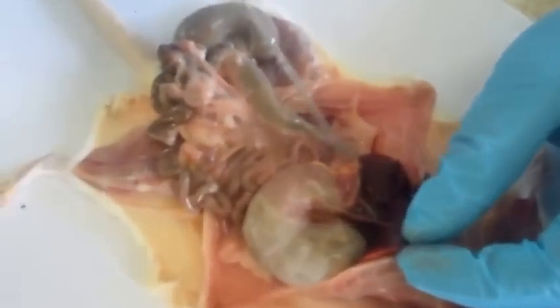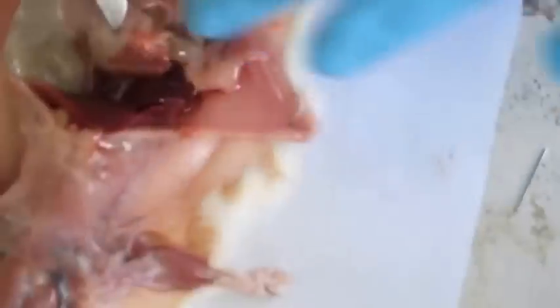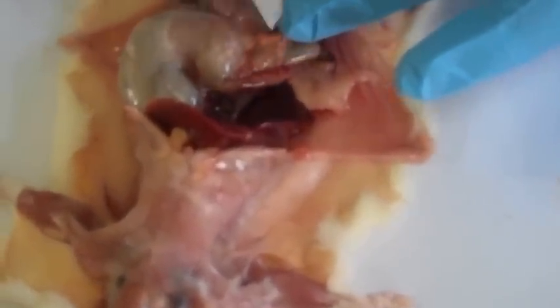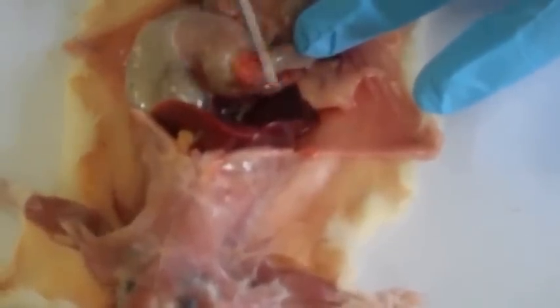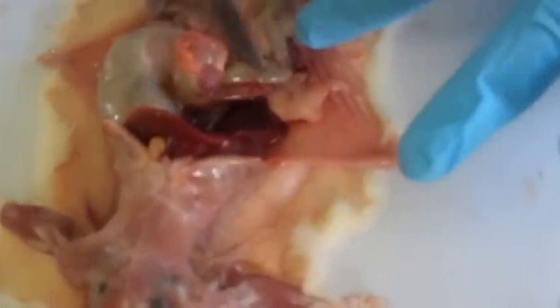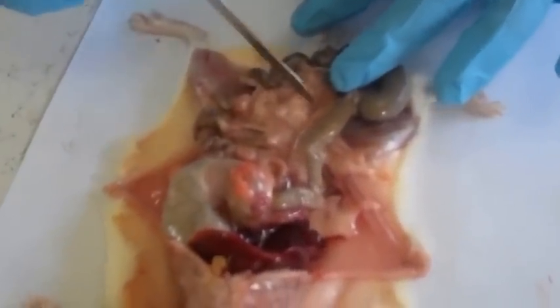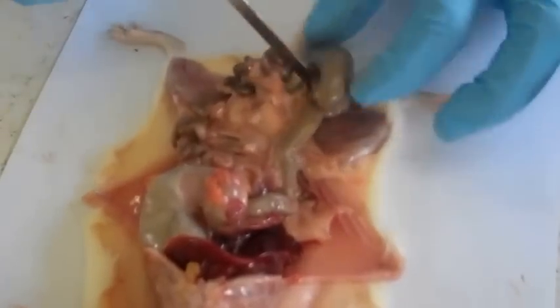And then just after the esophagus, we have the duodenum that is coming out of the stomach. Then just within the duodenum, we have the pancreas. This paper-like membranous membrane is the pancreas. Then we go on to the ileum, and you can see the ileum is really coiled and it has got some little blood vessels distributed in it.